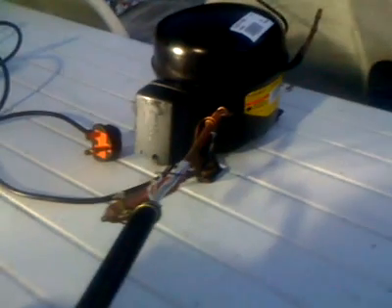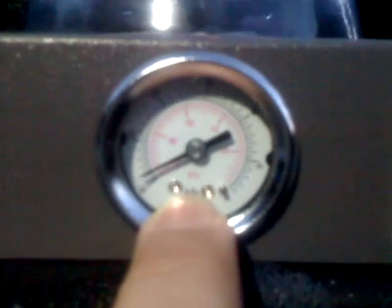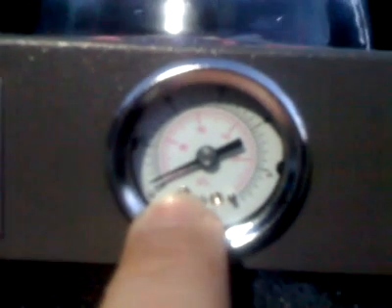Anyway, okay, that's on. With the compressor not running for, I don't know, 3 or 4 minutes, probably 5 minutes since I switched it off, you can see here in the jar that we are still holding, I make that just over 28.5 inches mercury. Of course, I'm treating this as accurate. I've no idea how accurate this is, but suffice to say, it hasn't dropped at all. Good old kid's putty doing its thing, and there's still quite a few bubbles in that splash, and in the little splashes over there, particularly in that larger glob.